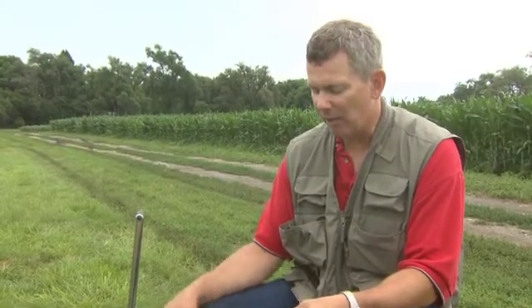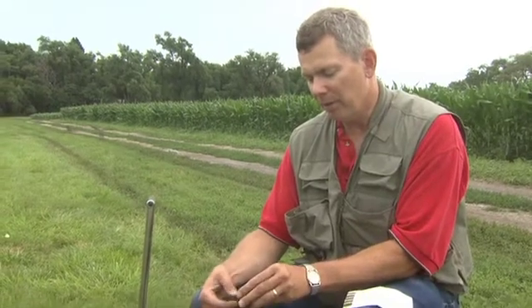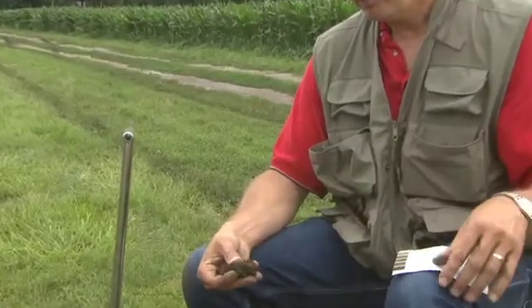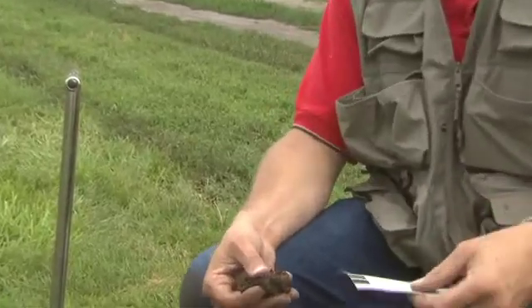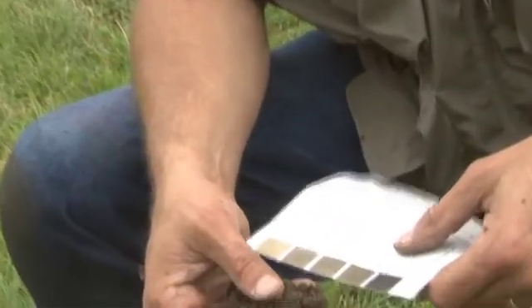Now we're going to test for soil organic matter. We've taken a sample from the bucket that we've previously sampled, and we want to make sure that we have moist soil — not too wet, but moist. We're going to break it open like this. If it's not moist enough, I would take my water bottle and moisten it, but I've got good moisture.